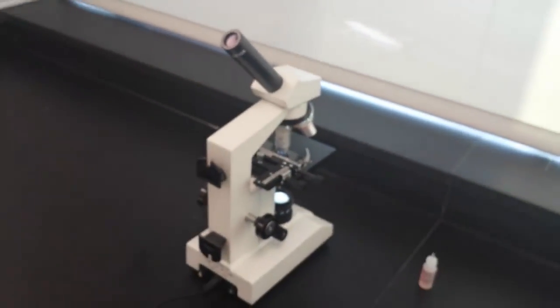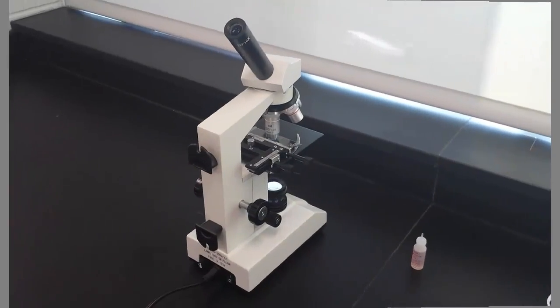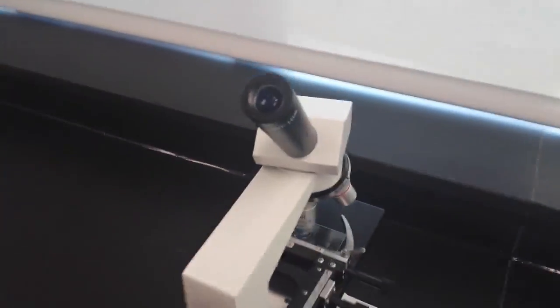And now we're going to go look through the eyepiece. Okay, I've got it focused. Let's go have a look.